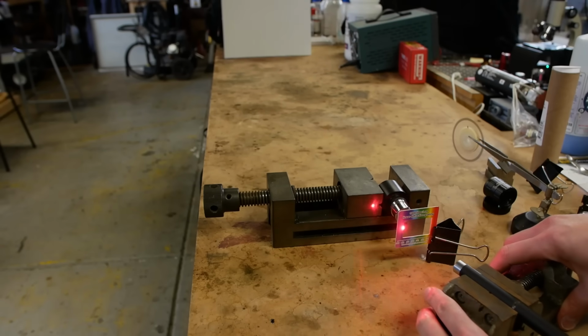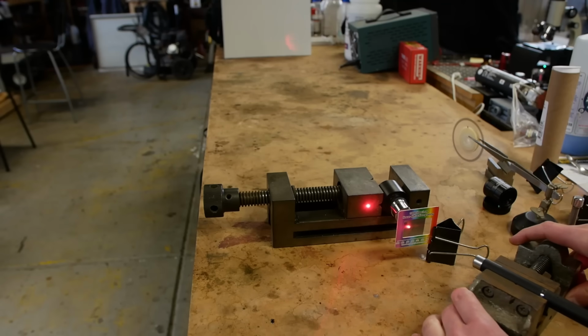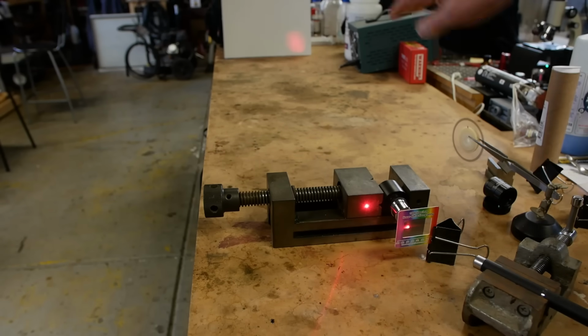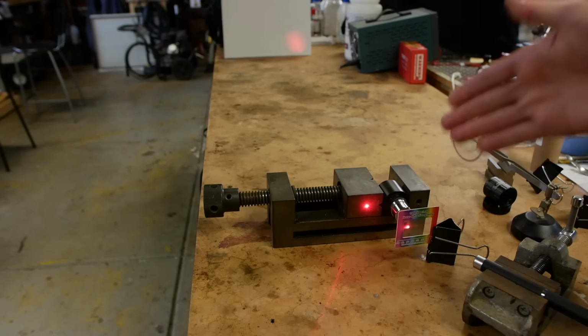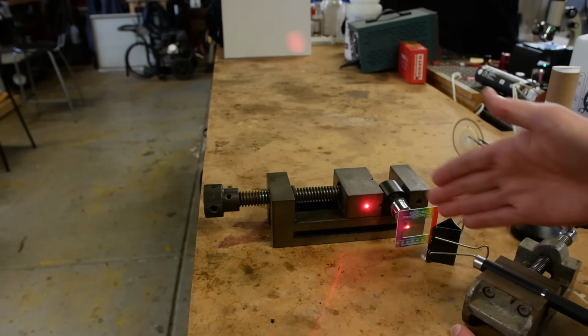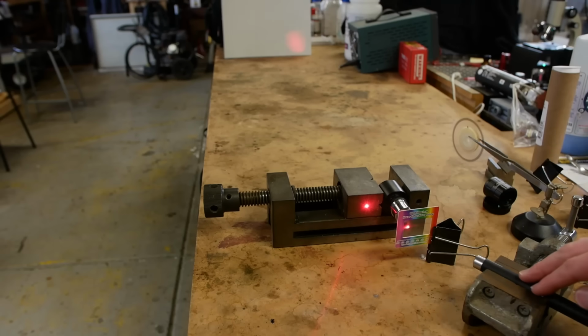So then we'll do our sneaky technique and rotate this laser pointer until the diffracted beam is going through. Now the primary beam is hitting here and the diffracted beam is going into the optics. So if we go down there and magnify that image, are we going to see any lines per millimeter? No, actually, because this optical system can't possibly image 1,000 lines per millimeter. The fact that we're seeing light down there just means that there's a region of the image that is diffracting, and actually the information is the angle that we're shooting the light into the grating.